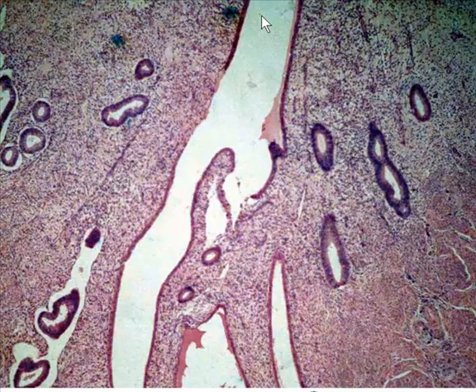When we get to the uterus slide, there are two uterus slides because we have to identify two different stages. In both of those, you need to identify endometrium and myometrium. Endometrium is going to have the endometrial glands, or the uterine glands that you see here. And then the myometrium is going to be the solid pink smooth muscle where those are absent. Maybe a little bit over to the right-hand side right here. So we'll see that in both of the uterine slides.